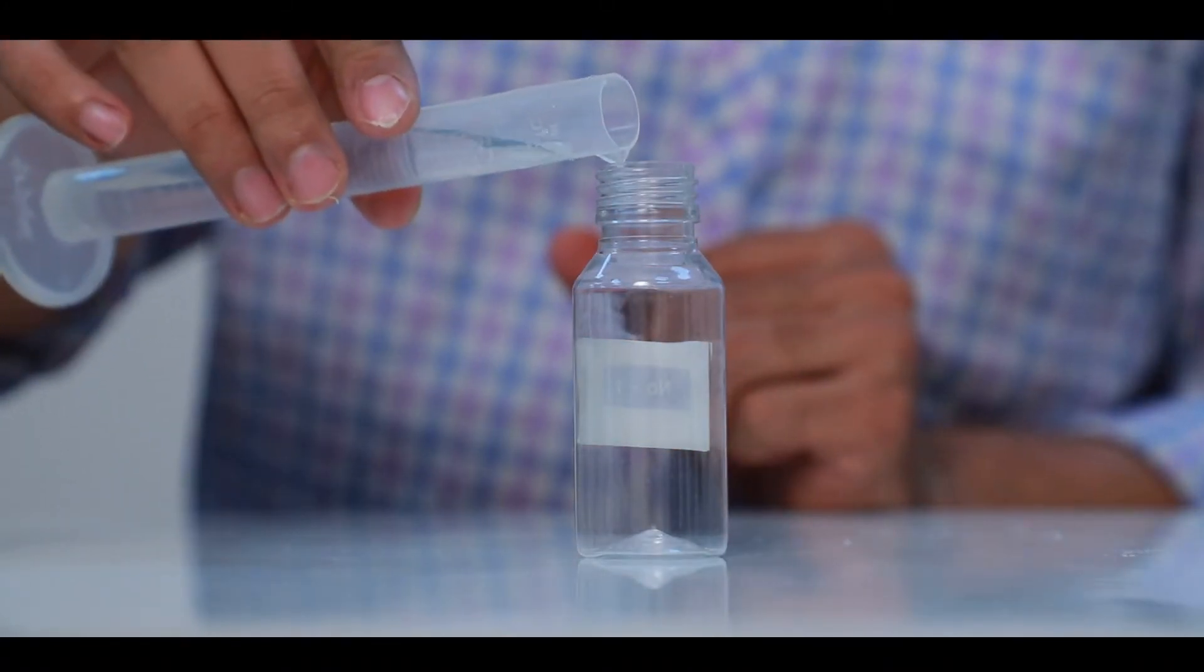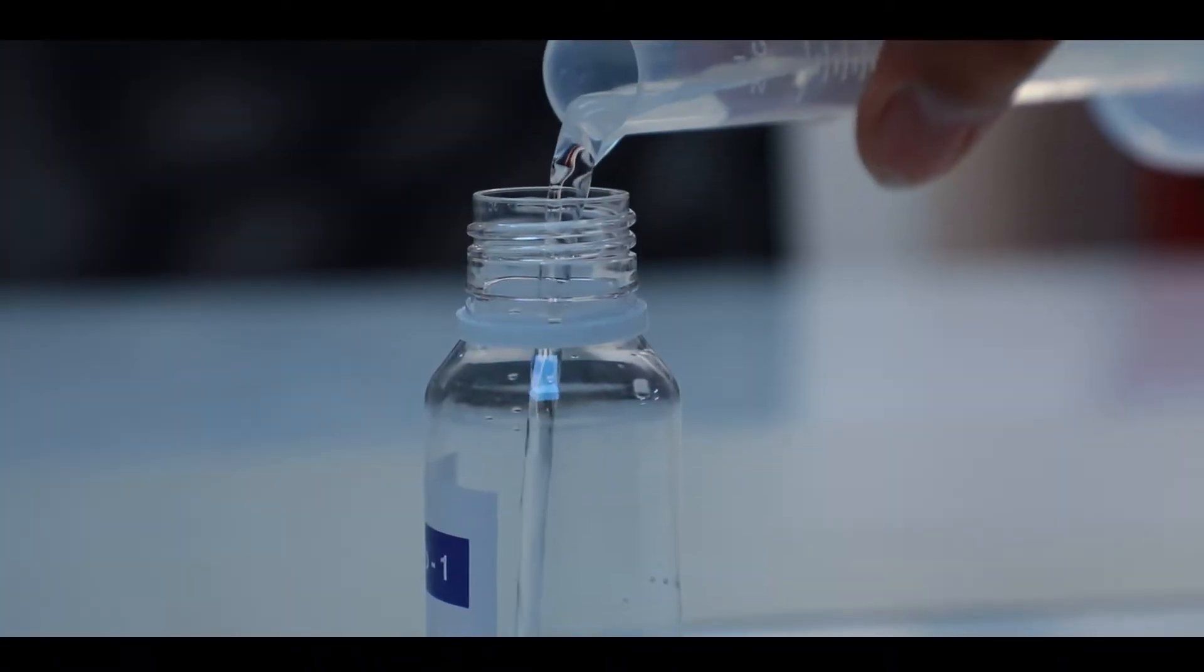Estimation of Total Hardness. Take 25mL water sample to the test bottle.